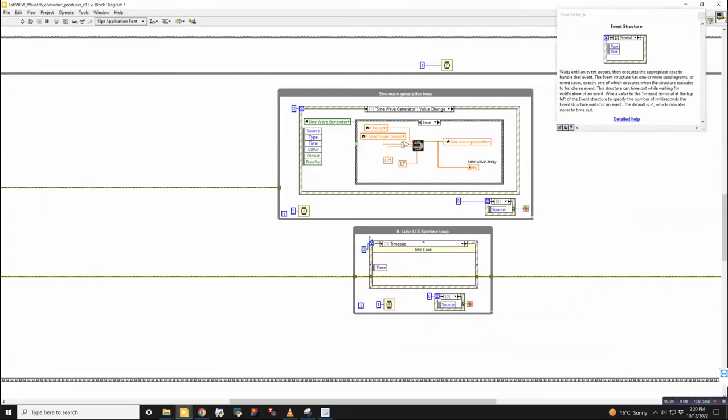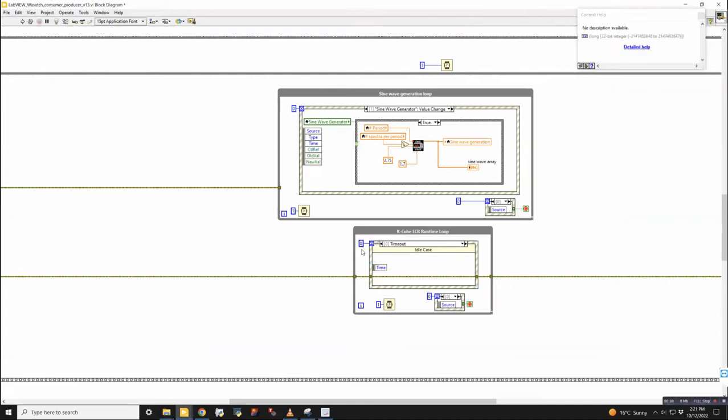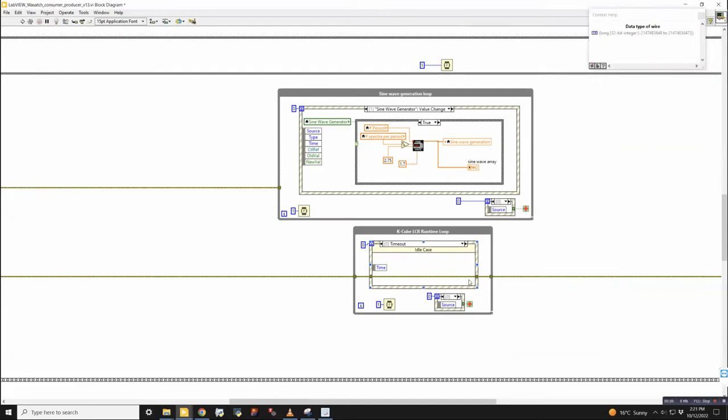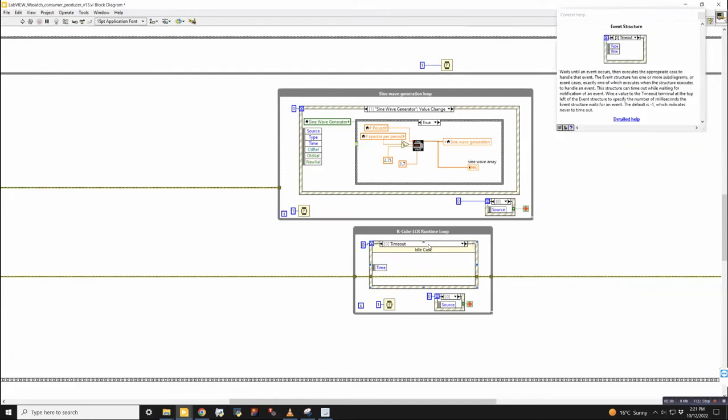So the core of any of these while loops is an event structure. Event structures are waiting for user input. The default case is this timeout case. And there's a little input on the top left, which is the event timeout timer. So instead of saying 1 millisecond over here, I could input 1 millisecond into this event structure, which says wait 1 millisecond for input. And then if there's no input, run the timeout case.